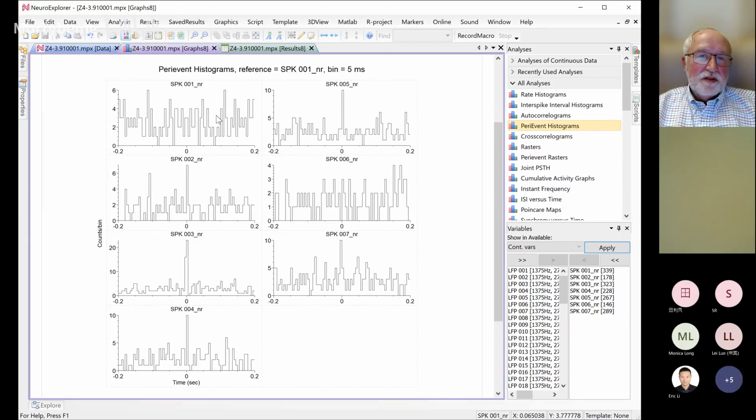The main information we see from this result is that if we take spikes on channel 1, then spikes on channels 2, 3, and 4 all have lots of synchronous spikes, except for channel 6. Channel 6 doesn't have any relationship, so it's random relative to spikes in channel 1. I see, thank you. If it was a stimulation, we would say that channel 6 has no reaction to stimulation, and all other channels have. So that's the idea. Great, thanks.